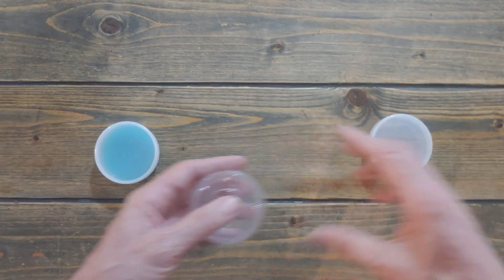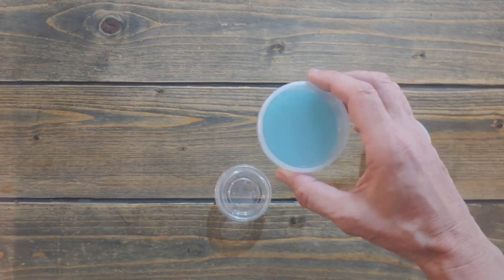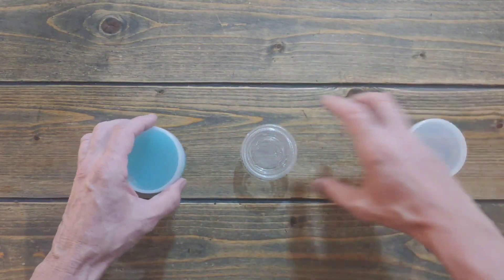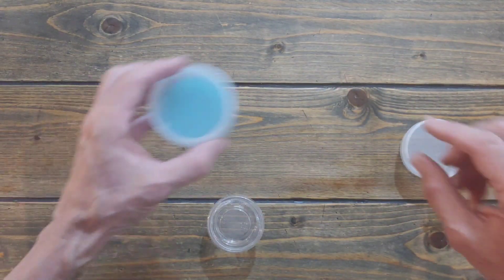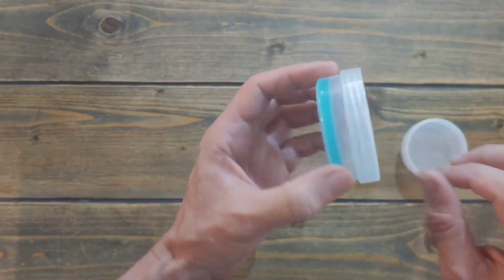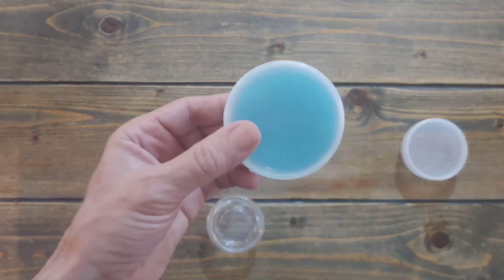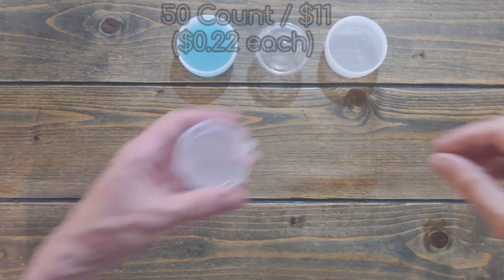I don't like pouring after, for a few reasons. Look how thin this is — we can get away with only 30 minutes of sterilizing because it's thin, very little material to sterilize, whereas the jar needs longer. My preference for these is that they come out of the pressure cooker individually. I just let them cool, when they gel and harden I put them upside down, wait two or three days, and all the condensation is gone. Don't use them before the condensation is gone — it's just messier. Make them a few days before you need them. Patience, as we always say.